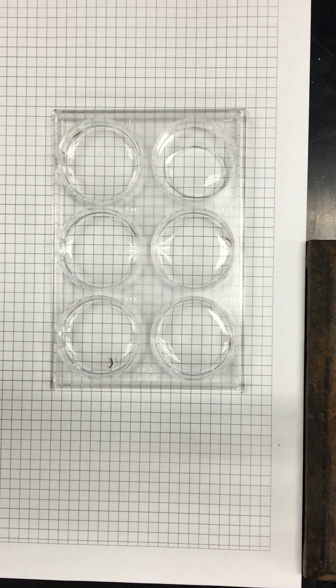Are my calculations correct, just to be sure? That's how I did it. That's the stock. So, the stock is 0.1. So, 4 mils of stock. I mean, you can use that, that's not a problem. Okay. And then what you should be doing, since you're doing a... we're going to do 2 mils of stock and then dilute it to like 12 milliliters. 12, yeah, that's how I calculated it.